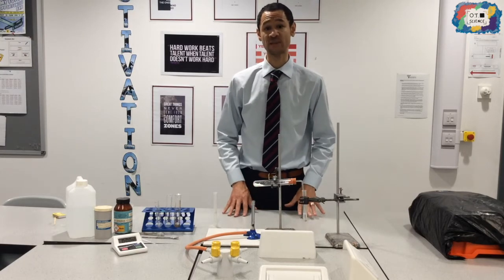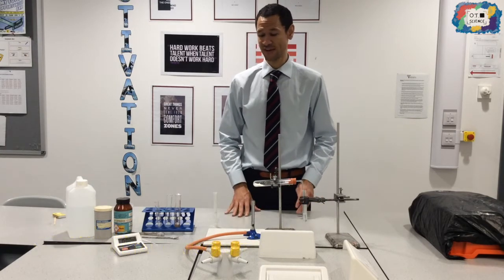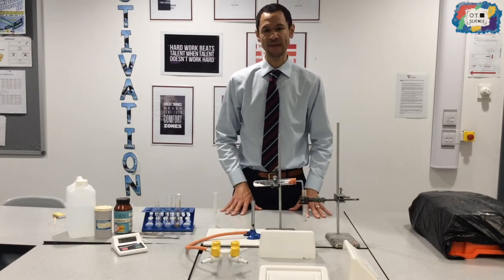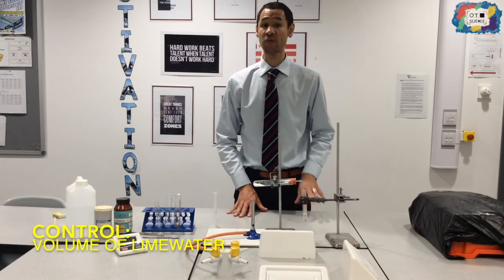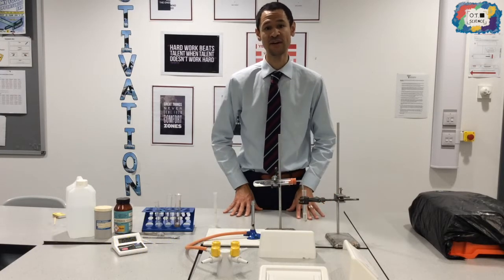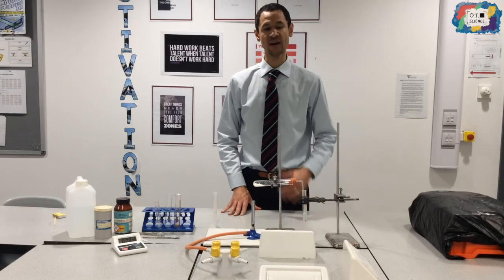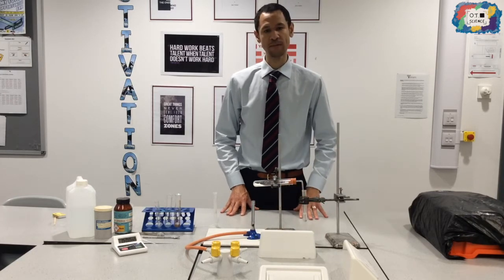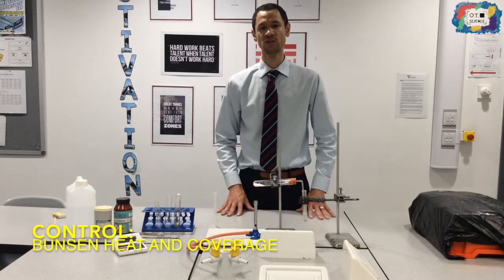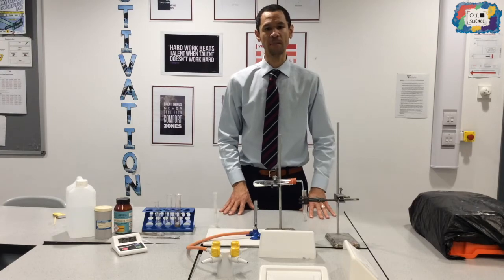One thing to control is the mass of the substance. Now you can use weighing scales to do that. I haven't chosen to do that today. I've just used 2 heaped spatulafuls of each metal carbonate into each boiling tube. I have measured out the volume of lime water, because different volumes of lime water might take different amounts of time to go from clear to cloudy. So I've put in 4 centimeters cubed of lime water, and I will do that after each round of the experiment. I'm also going to try and keep the heat in the same location on the boiling tube, just so that the coverage of that heat is equally distributed across that metal carbonate.